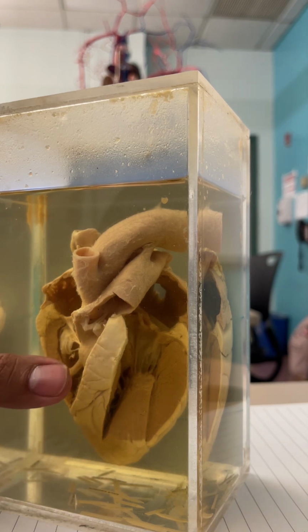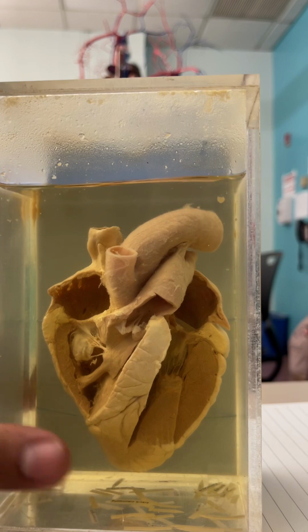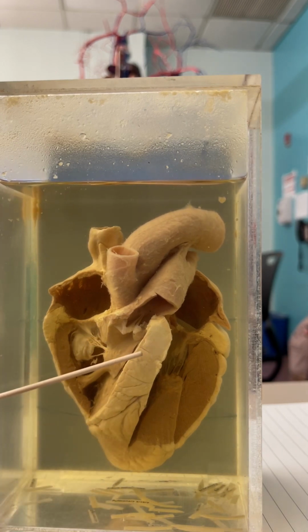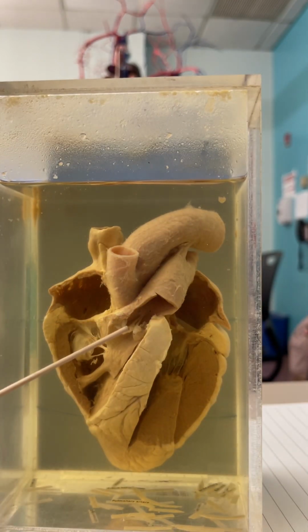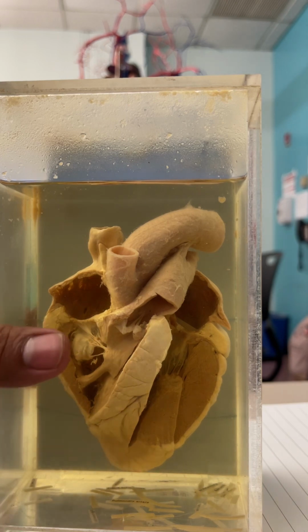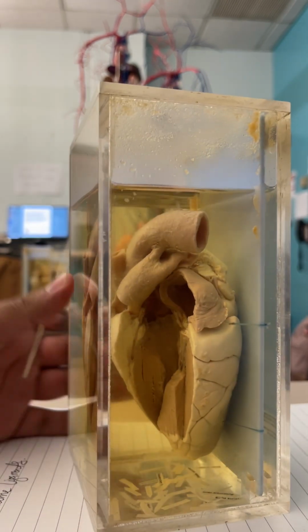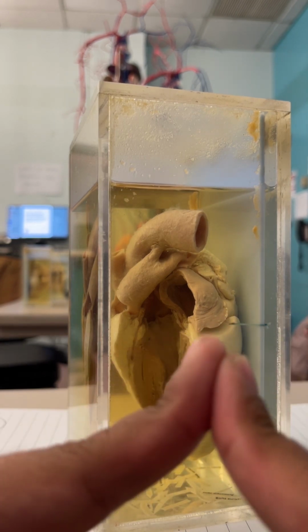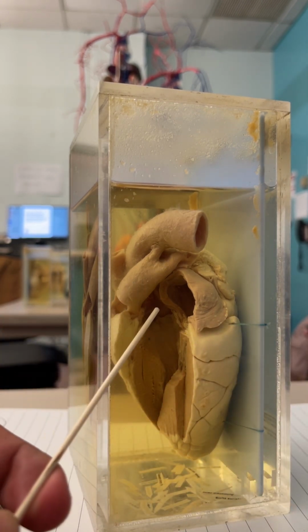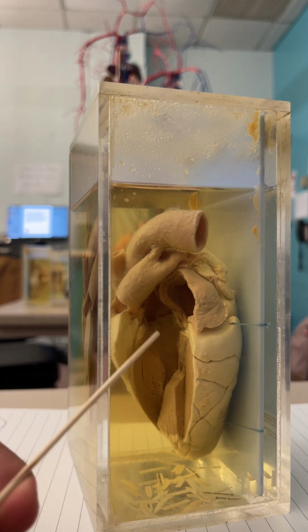Now, I didn't go over the semilunar valves yet. The pulmonary semilunar valve is right here. It looks like, again, like a piece of tissue paper, and it kind of looks like this, right? Kind of looks like a little door. So when blood pushes, it comes up. Kind of looks like that, right? And that's right there. We're looking for that same shape for the aortic semilunar valve, and if we look really closely, we can see in there, where it kind of looks, again, like this. Very, very tiny right there in the back.